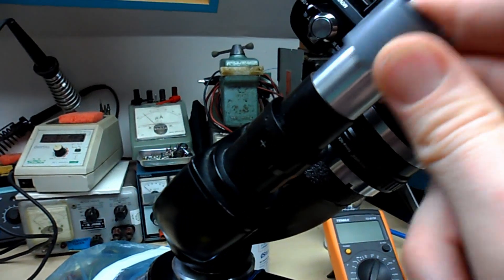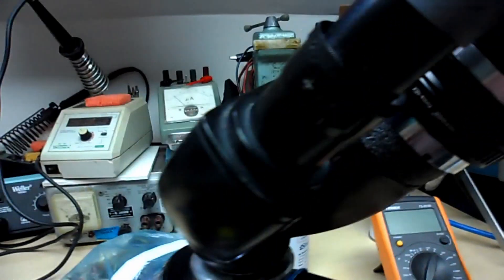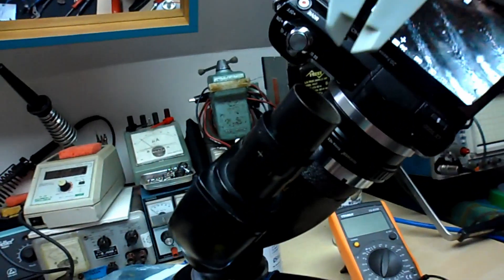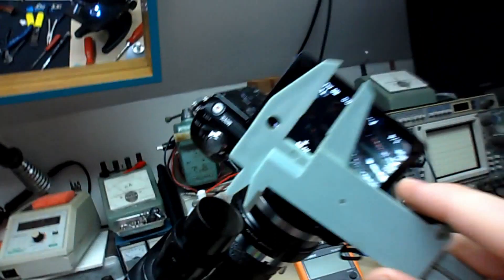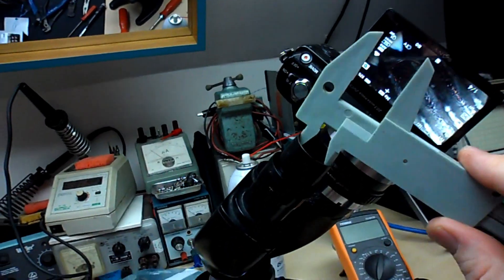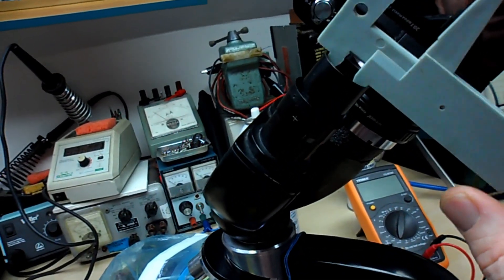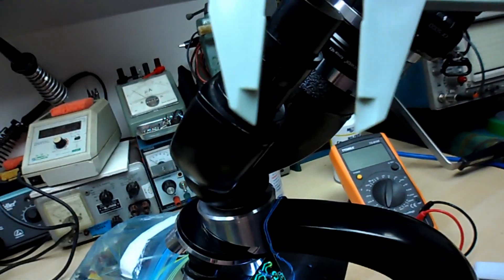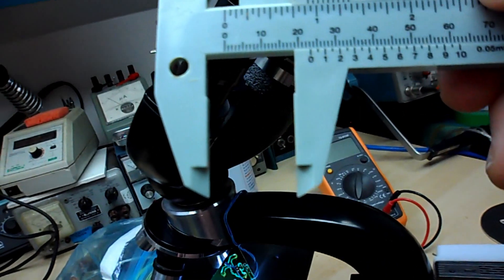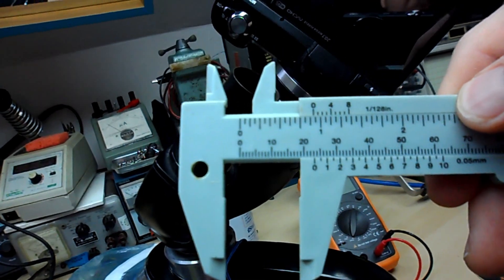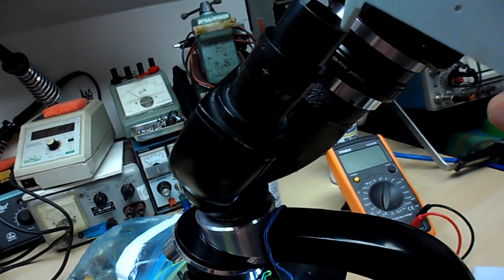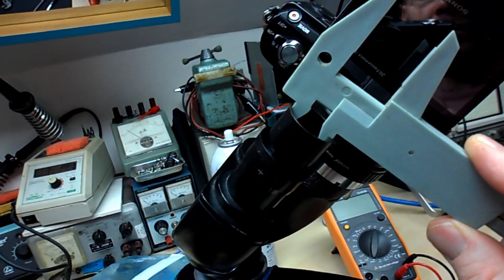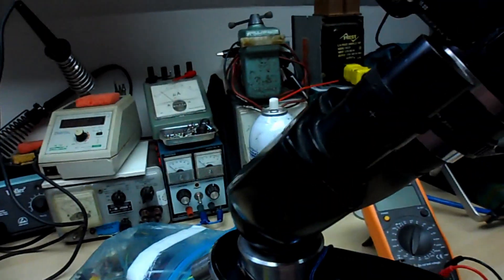I couldn't find anything that would fit. Let me measure it with the calipers. Well actually I'm wrong, it's actually 23 millimeters according to this on the inside. I don't know, maybe there's something out there that would fit this at 23. I don't recall. I feel like they were often 23 or 24. The ones that I saw were bigger.